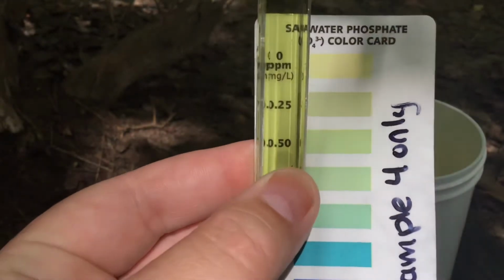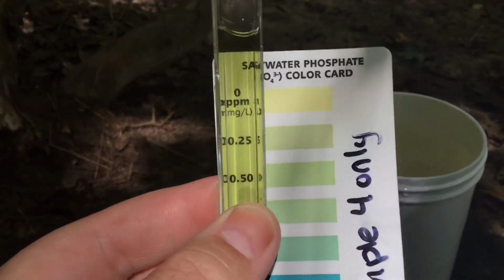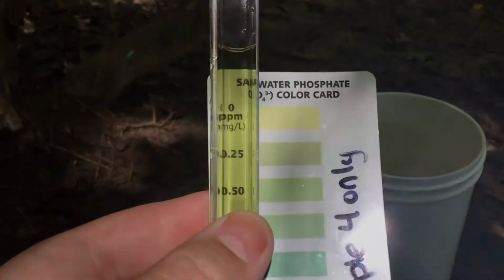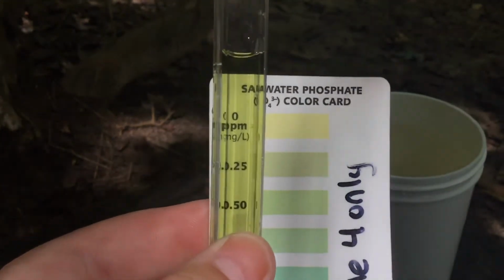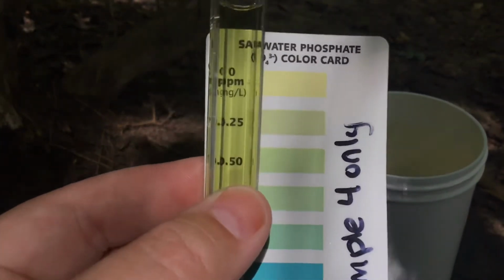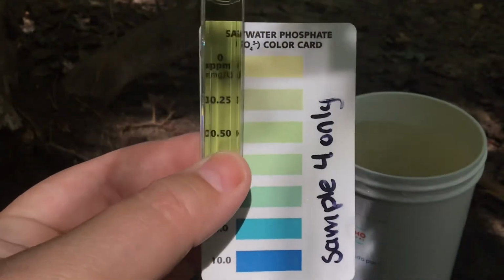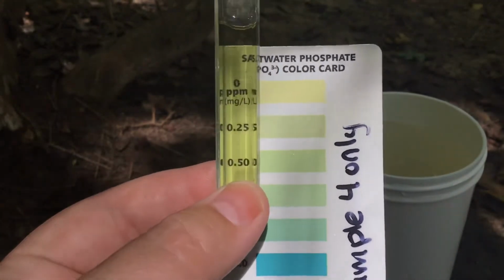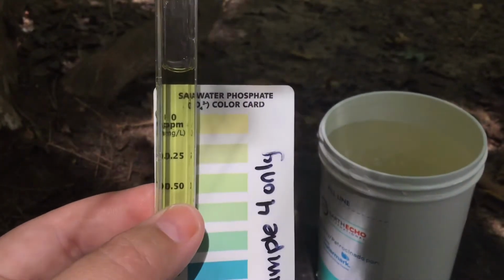And this is good because this means that maybe the contamination that we saw with the nitrate levels is not as bad as we think. There may be just a mild natural cause for the nitrates to increase, and maybe not a big chemical dump problem in our water system. So this is good news for our water system. Now let's go see what we can check out now that we've done our chemical analysis.